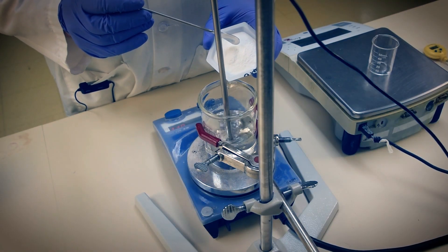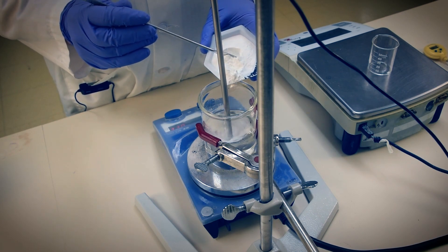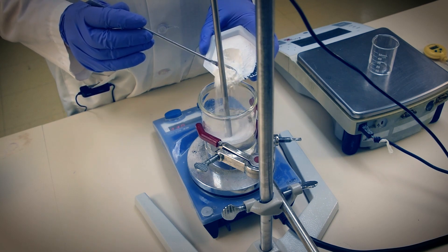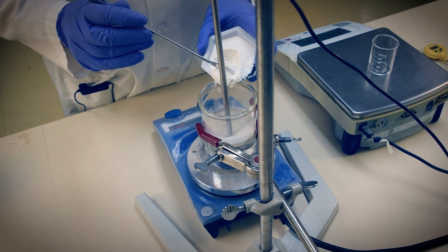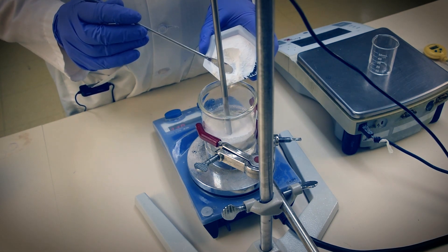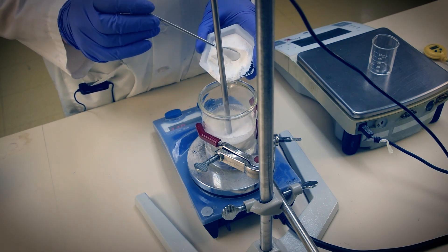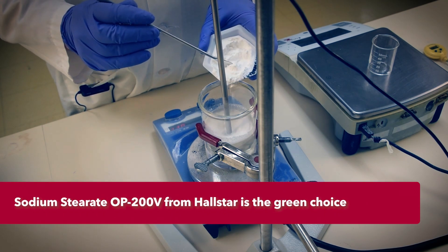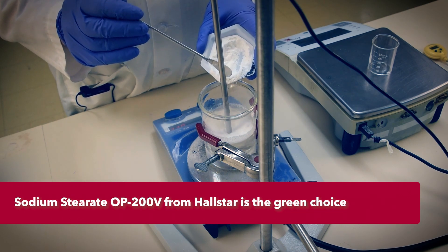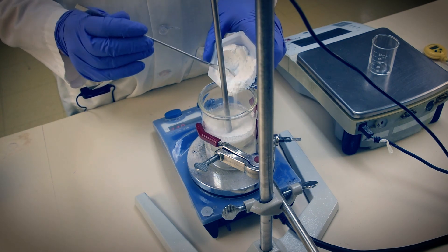Our temperature is at 85°C and we're mixing at high speed, so we'll add sodium stearate to this. You want to disperse the stearate salt into the polyols as much as possible, so we'll let this mix 30 minutes to an hour before adding the water. We're not using just any sodium stearate — we're using the right one for the job: OP200V from Hallstar. This metal stearate is the most efficient gelant for this type of formulation, and it too is derived from renewables.